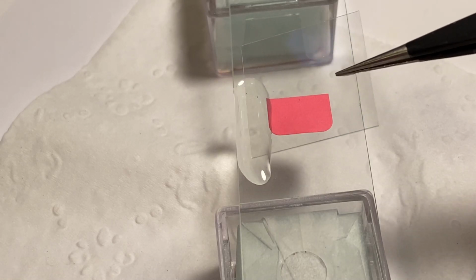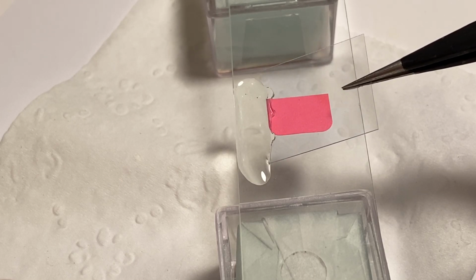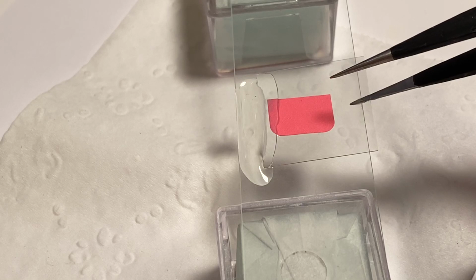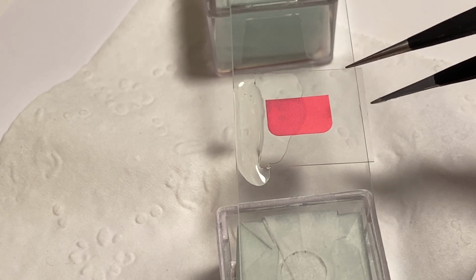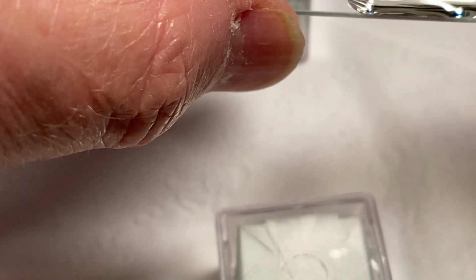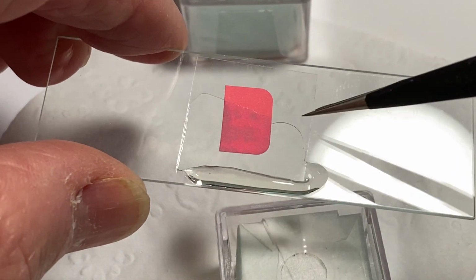So I'm going to take the cover slip and go right to the edge. You'll see the xylene, you see the glass pick up the xylene there. And then I'm going to lower the cover slip very gently. Don't hurry it. And let it flow. And it's not flowing, is it? See, why isn't it flowing? Oh, there it goes. It's flowing. Yes. You can just barely see. You can see it flowing right there.